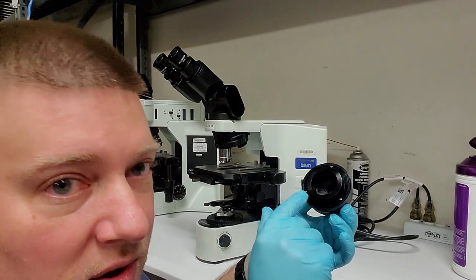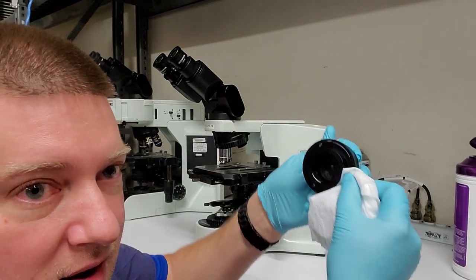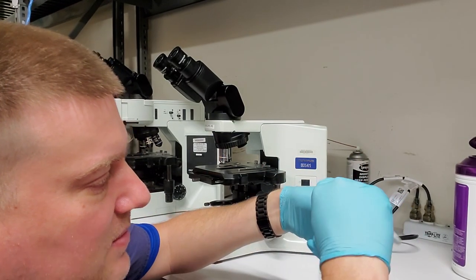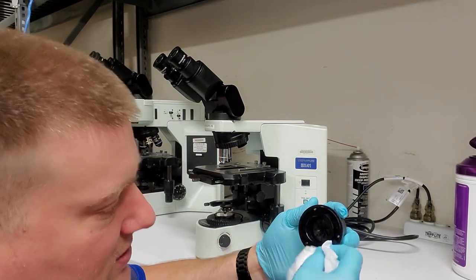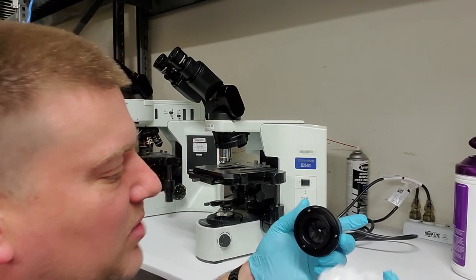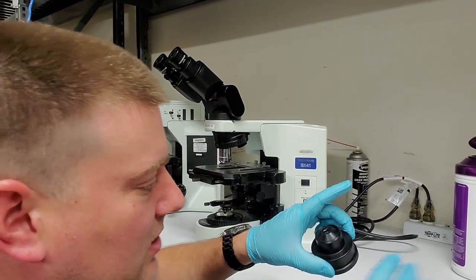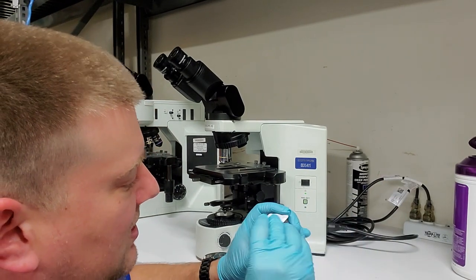There is some oil and contamination around the outsides of this, so I'm going to go ahead. I have my Sani wipe here. I'm going to wipe that down because I don't know if that's goo juice, like human goo juice, or if that's lubrication. I don't think it's lube. It didn't spread like oil. Oil can be a real pain. Let's check this guy, make sure this guy's clean.